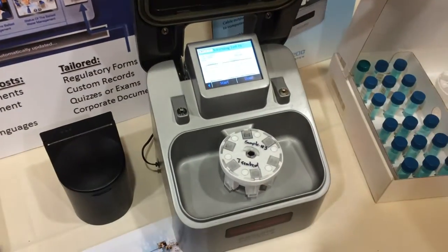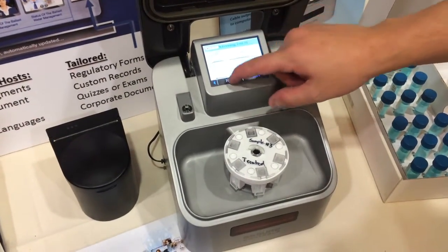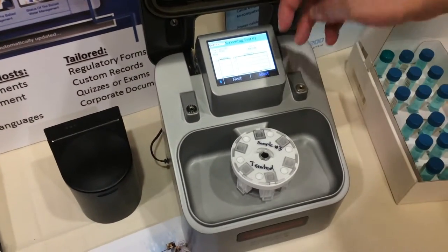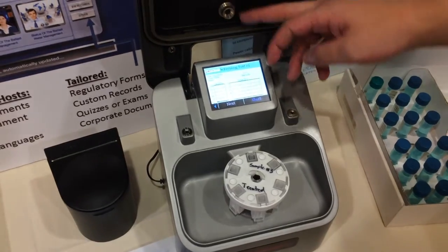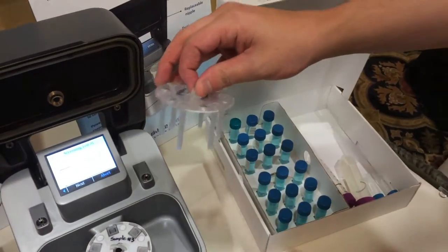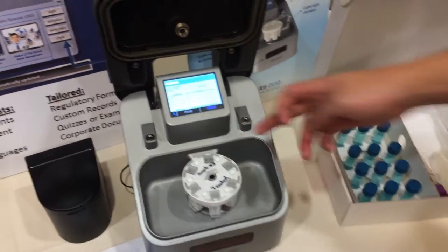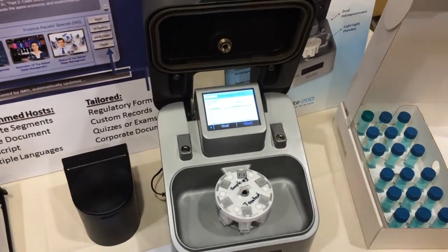This will be put into the machine and we're able to run through a test. This would be closed normally to keep it a light-tight chamber, but the agitation is happening up here through the nozzle. The agitation goes down through these straws, bubbling into the liquid in this container, which is then where the camera in the back picks up the light output.